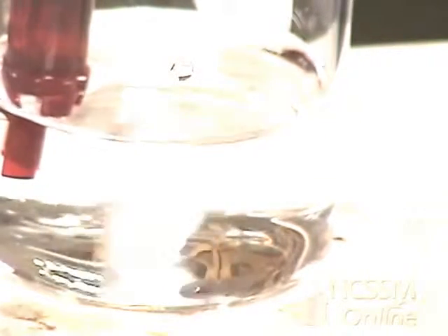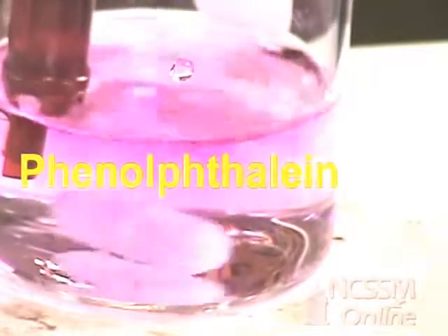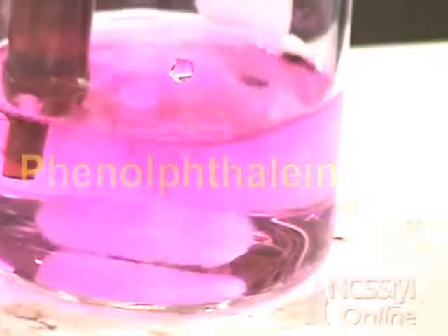We're going to use two indicators in this titration. The first indicator is going to be phenolphthalein. Phenolphthalein is an acid-base indicator. It changes from pink to colorless in a range of about 10 to 9.